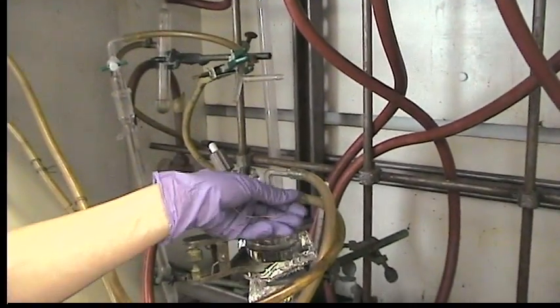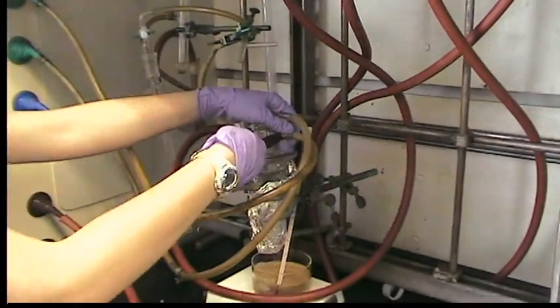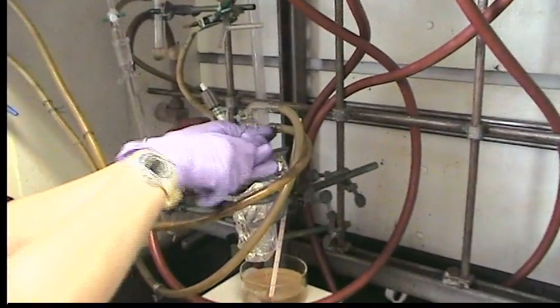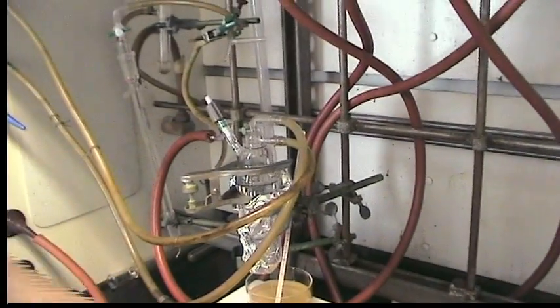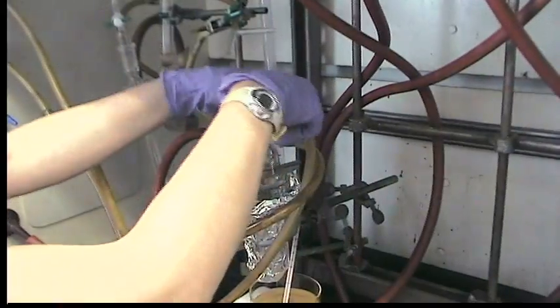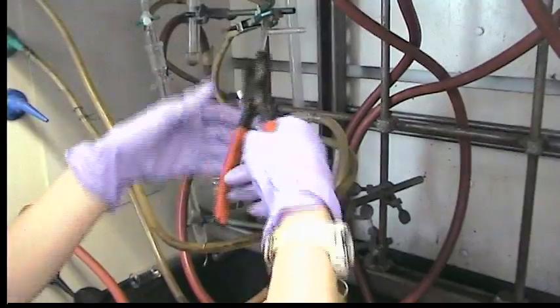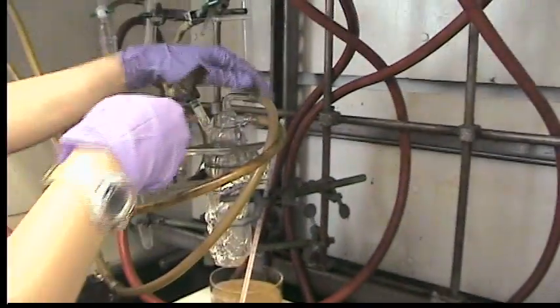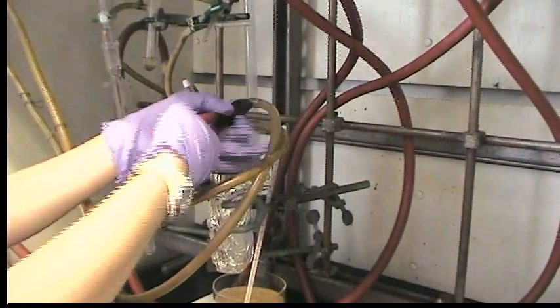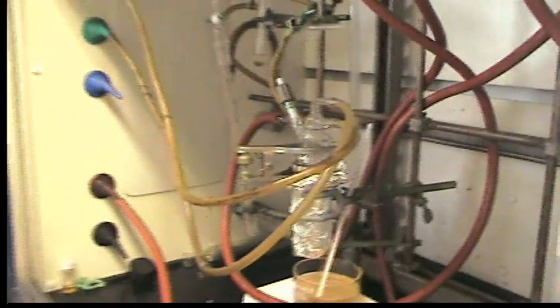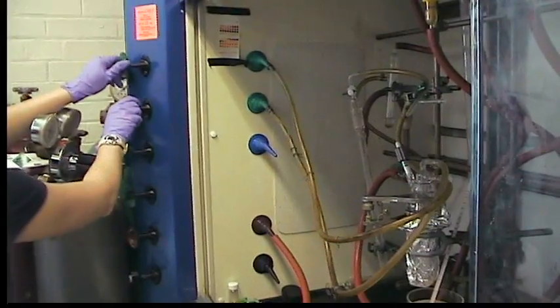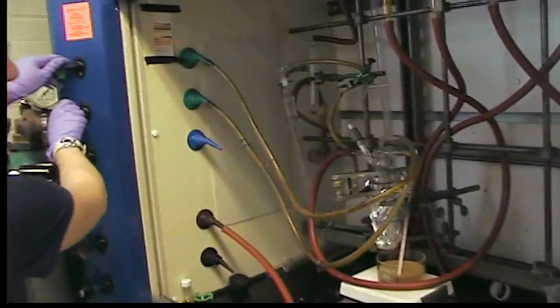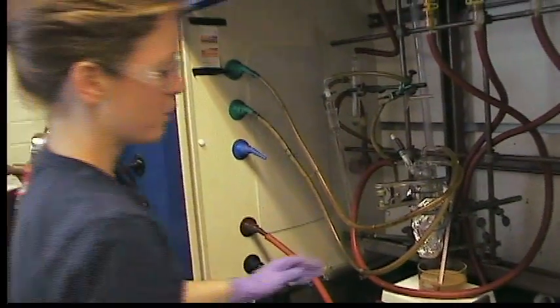You definitely want to wire down your sublimator so that the water doesn't pop out. You want a good flow of cold water for the entire time so that your reaction stays really cool.